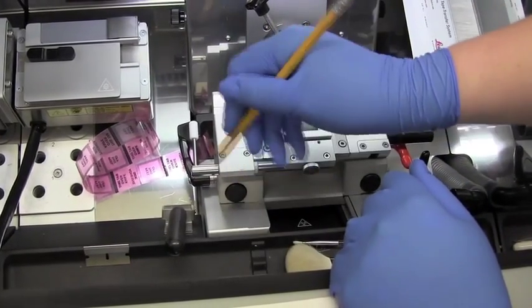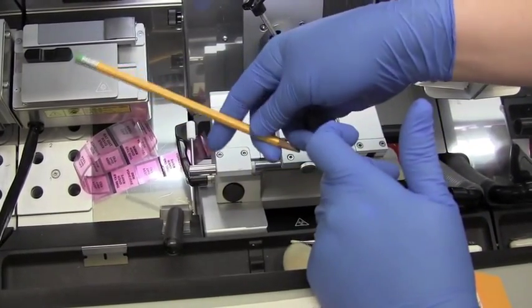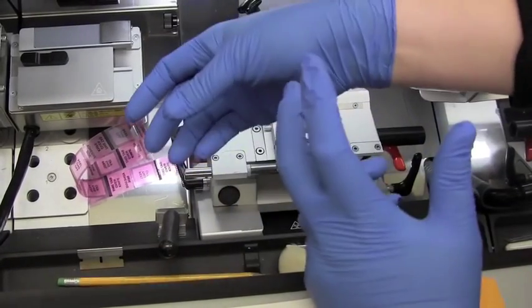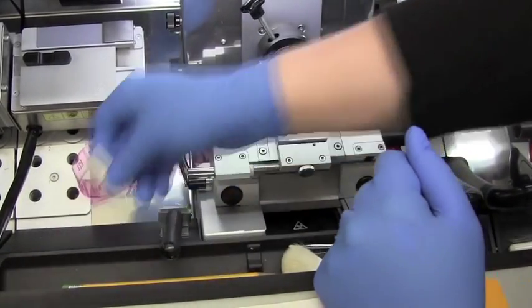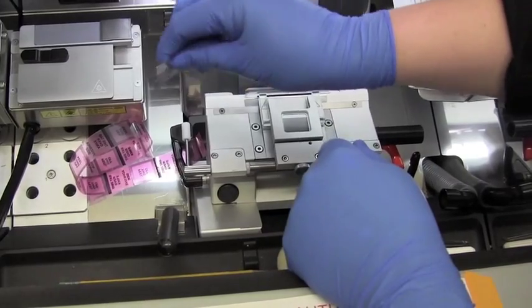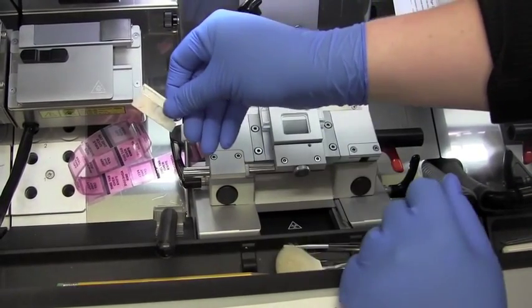A pencil for writing on our slides. When we do the ethanol washes later on, you're going to lose anything you write in pen. We need a cold razor blade so that we can cut the block that our sample is mounted in.